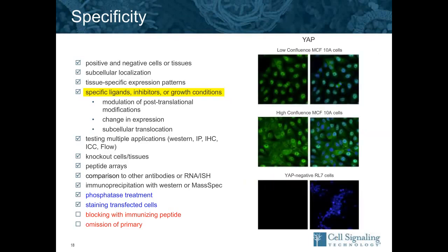We can also look at translocation. So here is YAP, and you see in low confluency, YAP is restricted to the nucleus, and as the cells become more confluent, you see cyto and nuc. And you might think that's kind of messy stain. I don't know if that's real, but you can see on the bottom there's a YAP negative cell line, and there's no stain in there.